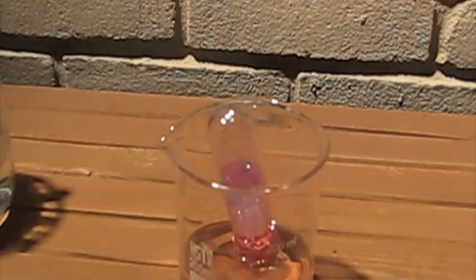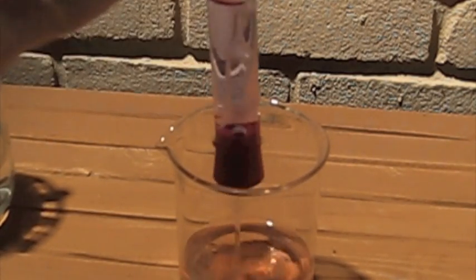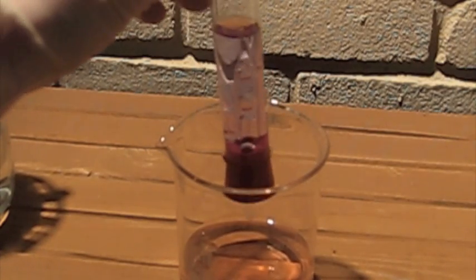That was cool. Not so much of a fountain - more like an explosion inside, but not really an explosion because nothing broke. More like a splat.